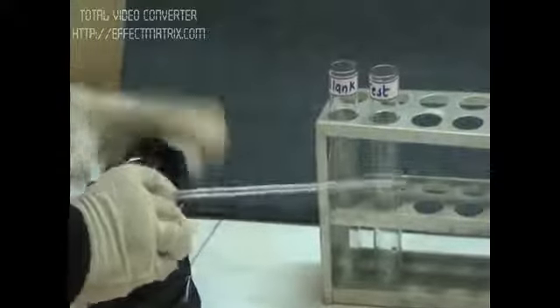Our PNPP, the substrate, is light-sensitive, so we have wrapped it in black paper.